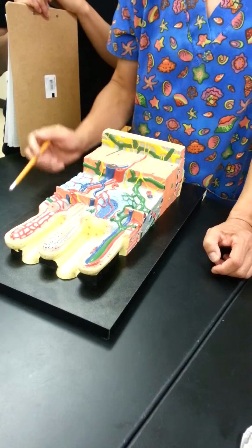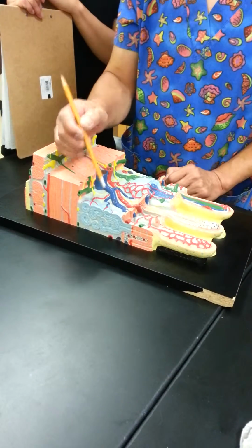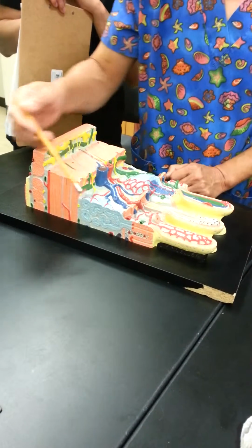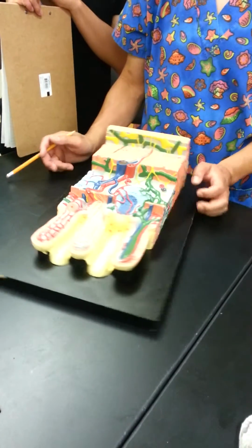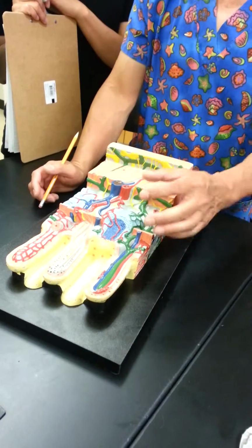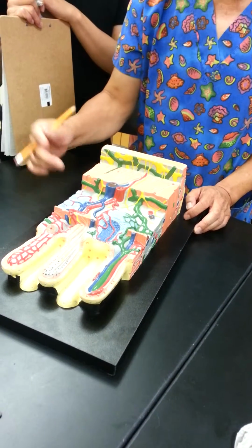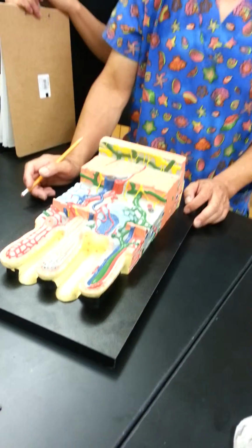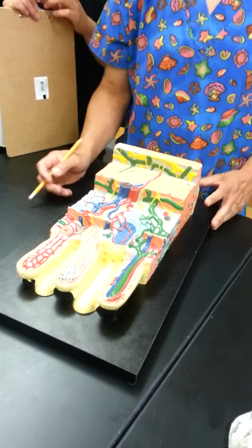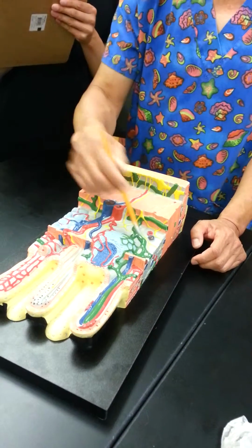Mucosa associated lymphoid tissue. Then in the submucosa, you would have the main body of these coiled ones. This is a multicellular mucus gland. Okay, you see the duct going up to the lumen. So that's the difference between this kind of gland and those kinds of glands. Okay, the ones in the mucosa would be digestive glands. The ones with the main body down in the submucosa would be the multicellular mucus glands. And of course you get larger blood vessels here and lymph vessels, etc.